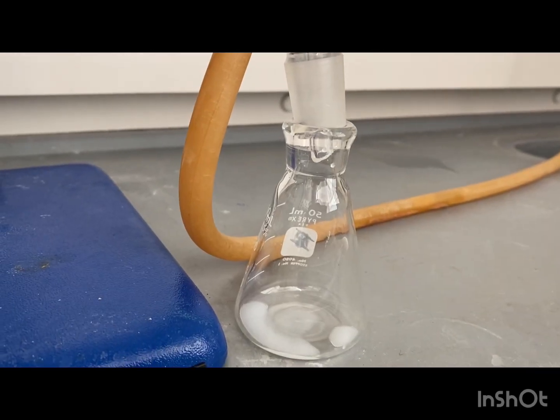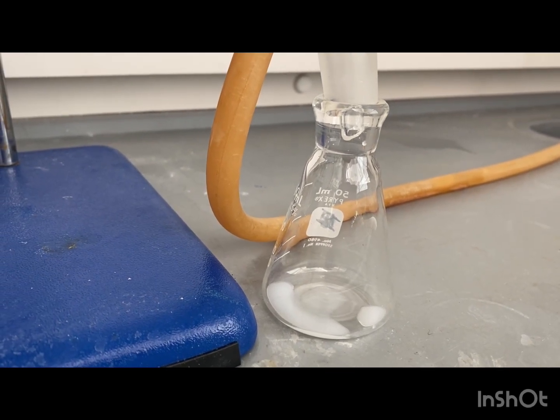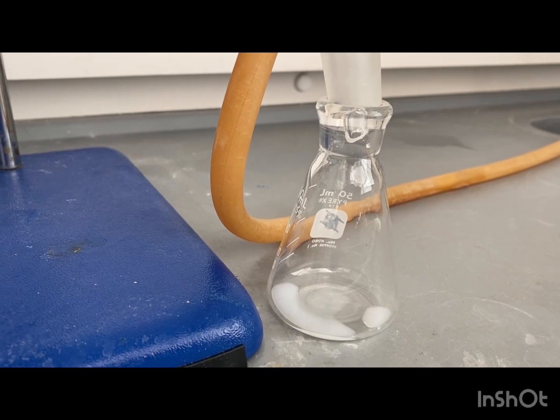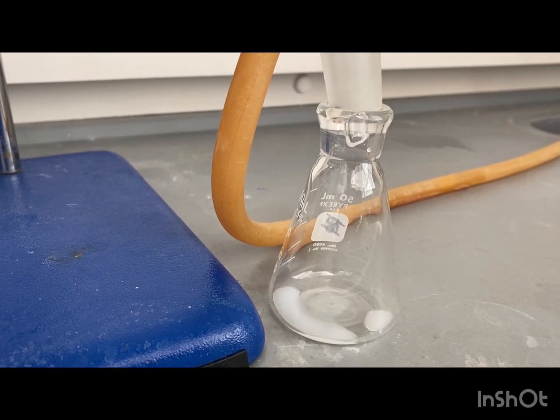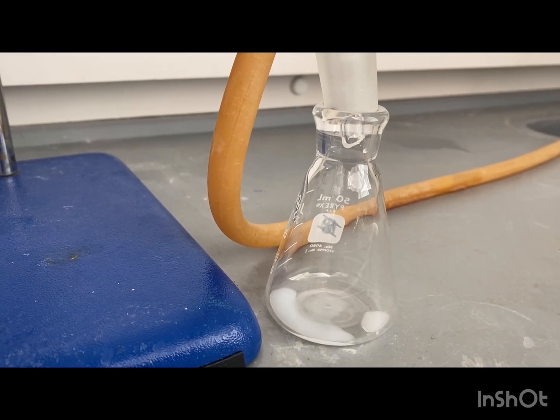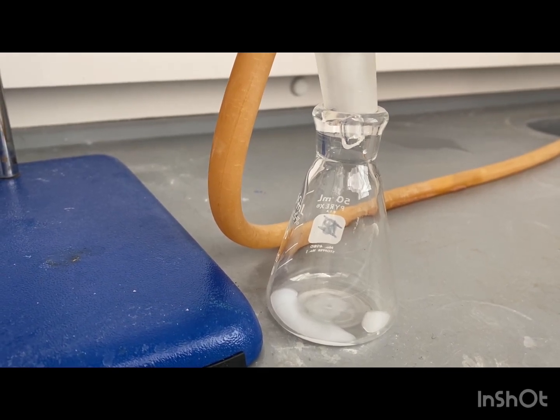As you can see the distillate is very cloudy. That is because the cinnamaldehyde and water are coming over through our condenser and that's what gives that cloudiness to our distillate.